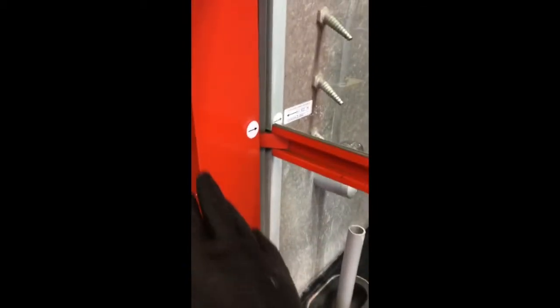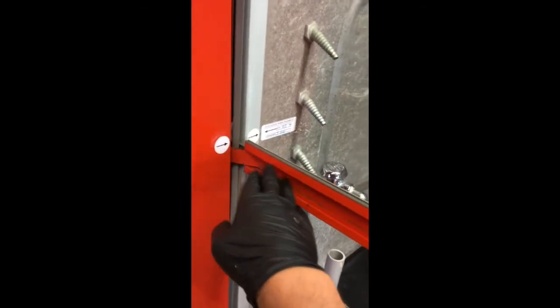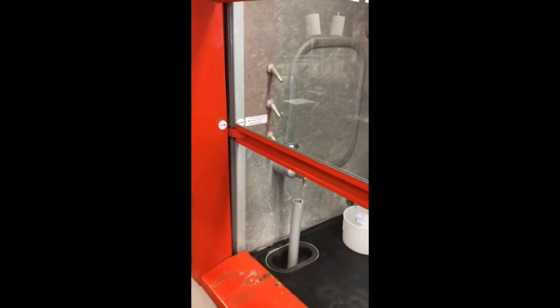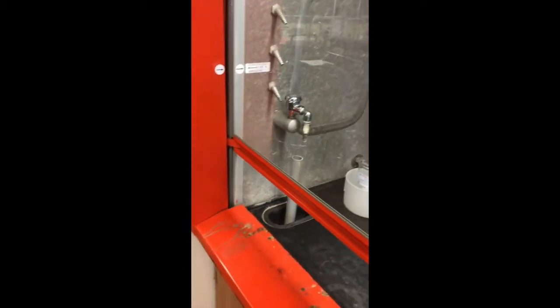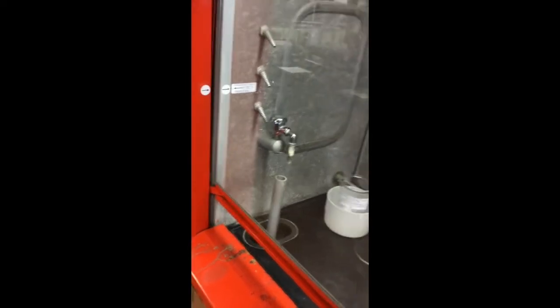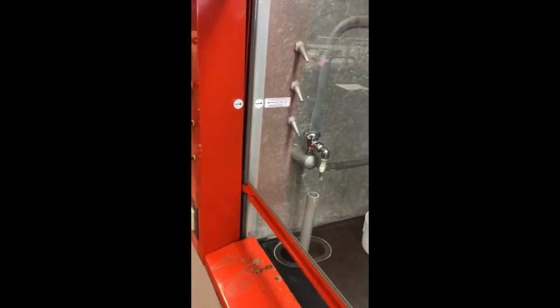But see this arrow right here? This arrow is the highest point that you can bring this sash. The sash is basically the window of this hood. So you can have it all the way down. It's fine. It's actually working at its safest if it's all the way down. But the maximum height is that arrow, and that's 18 inches.